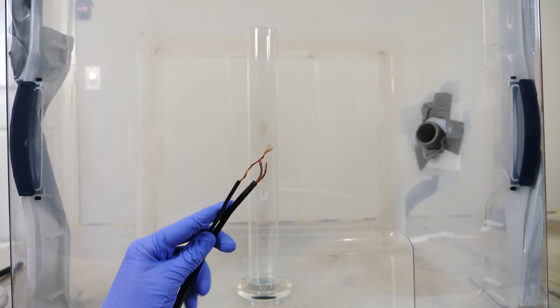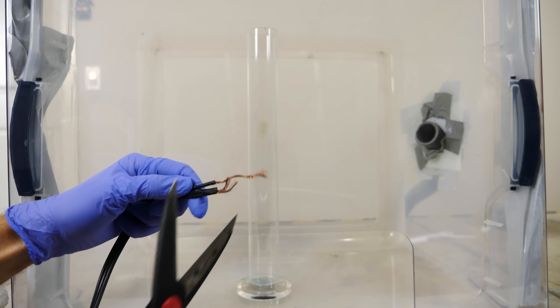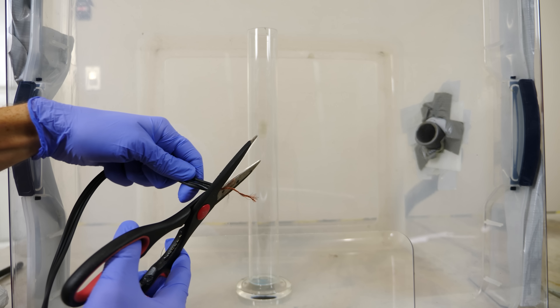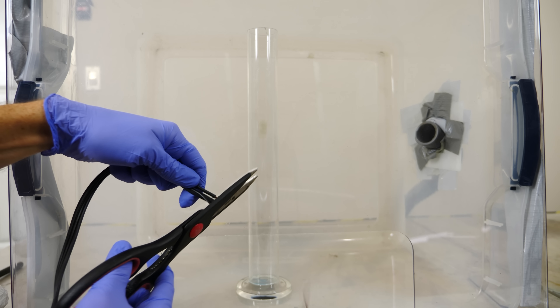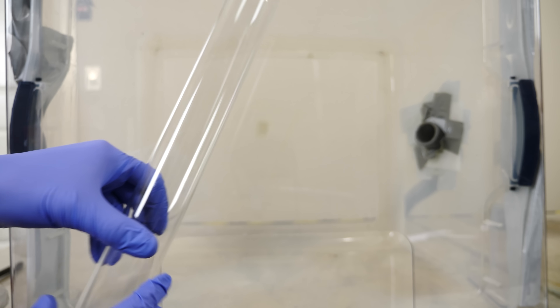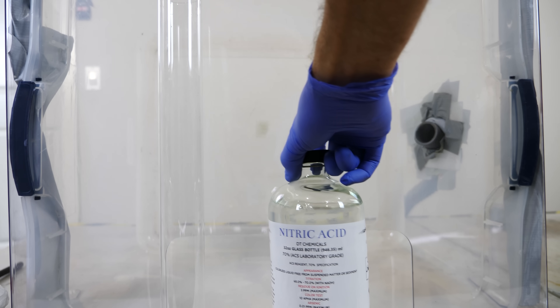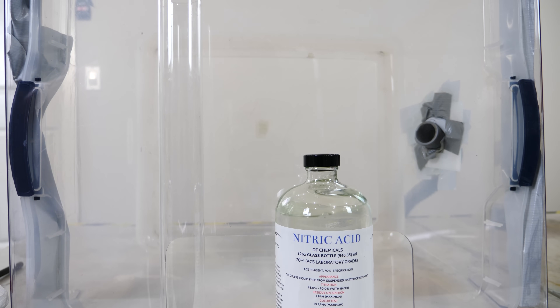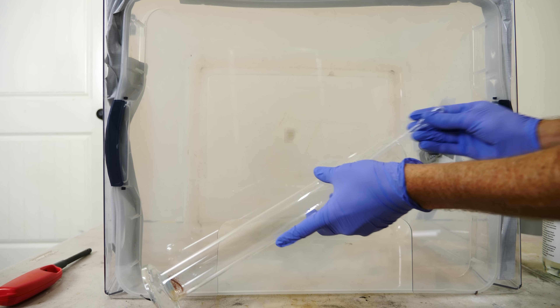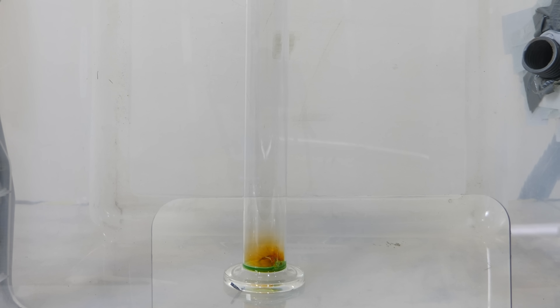In order for this to work, I need some copper, so I'm just going to use some copper wiring here. I have my copper at the bottom, and then we're going to add some nitric acid to it. When you pour nitric acid on copper, it forms something called nitrogen dioxide.